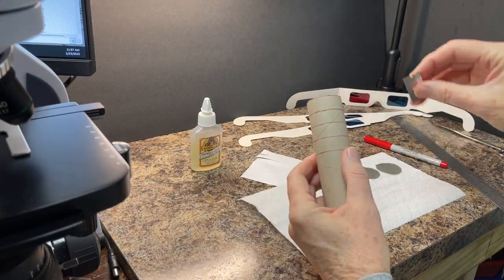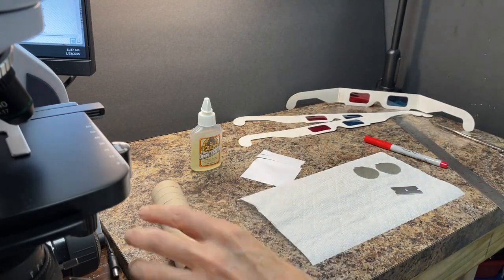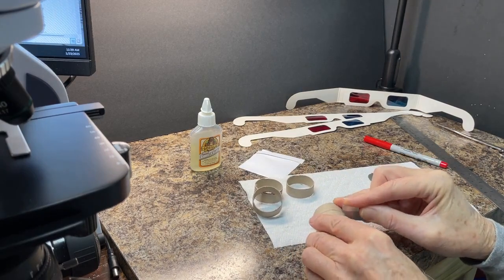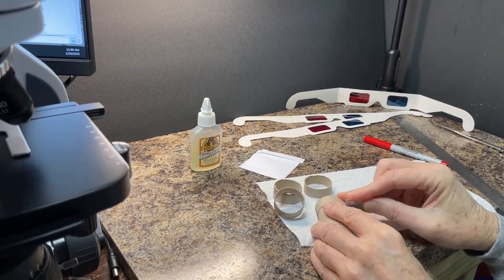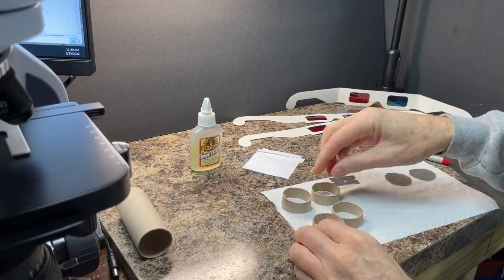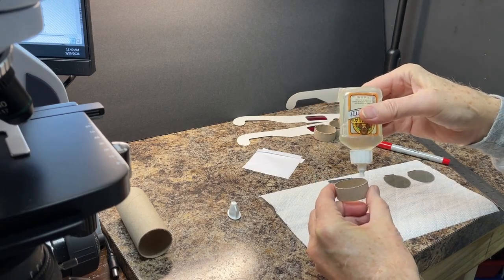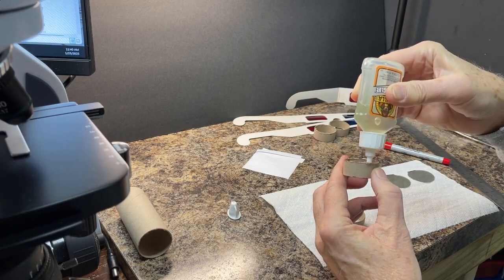Cut the sections from the cardboard tube. Watch your fingers. Glue the cardboard sections to the polarization film circles. The film tends to curve, so you'll need a weight to hold it down while the glue sets.